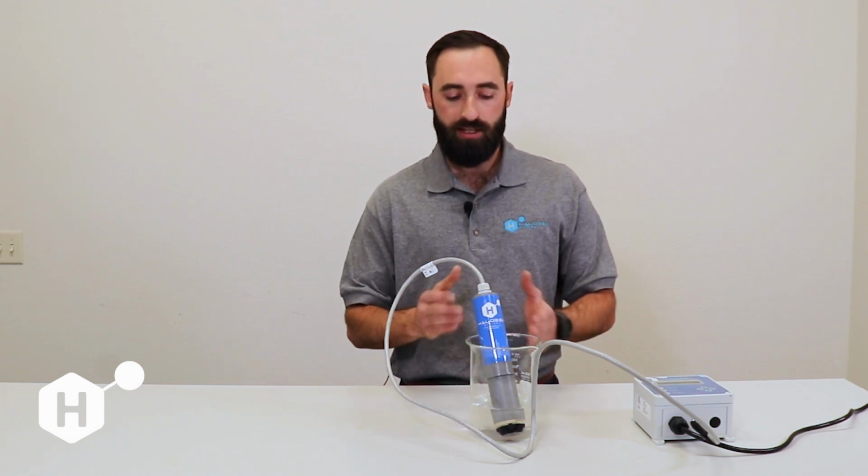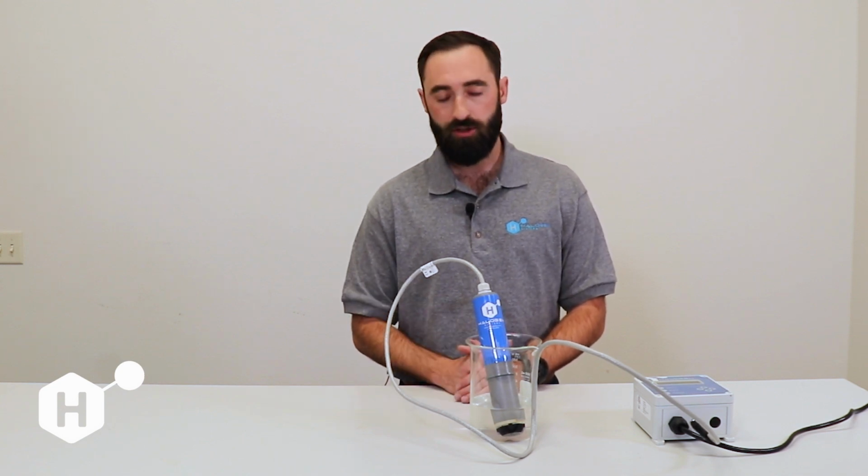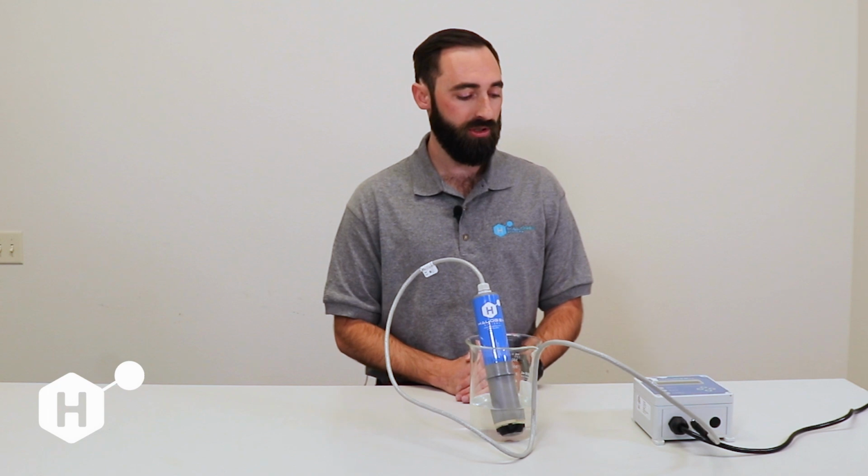Each calibration is specific to the sensor. It's not just a standard default calibration. Rather, it's a specific calibration that we did here. So it'll still be accurate, and you might just need to redo whatever points you might have done that are specific to your system and water conditions.